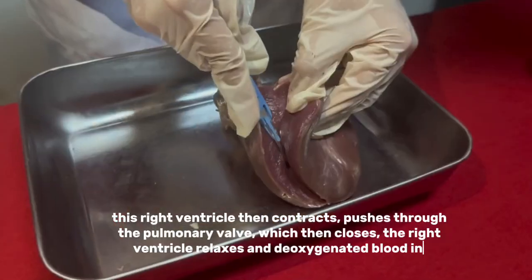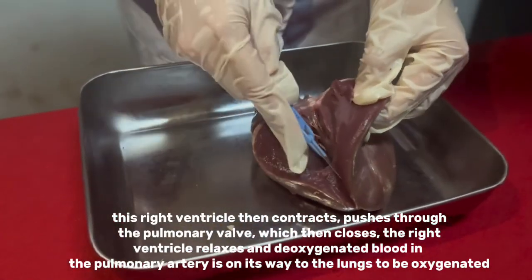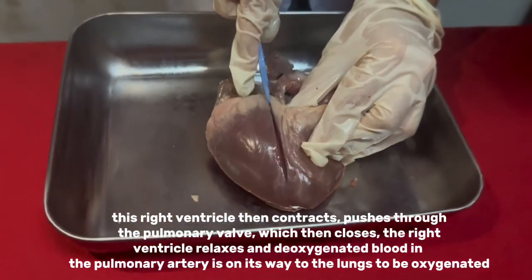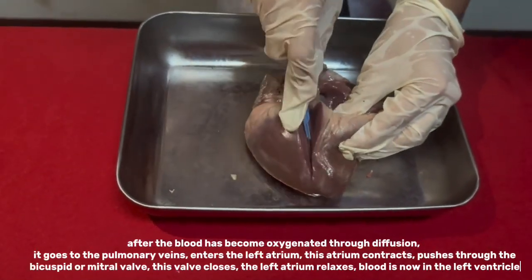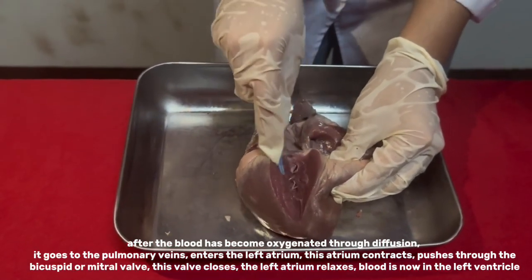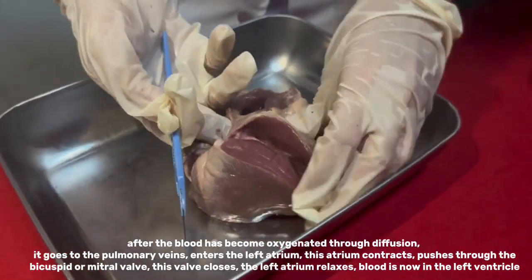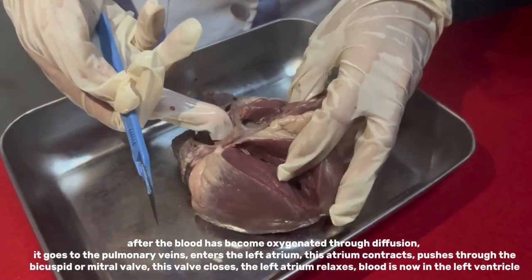This right ventricle then contracts and pushes blood through the pulmonary valve, which then closes. The right ventricle relaxes and deoxygenated blood in the pulmonary artery is on its way to the lungs to be oxygenated. After the blood has become oxygenated through diffusion, it goes to the pulmonary veins and enters the left atrium. This atrium contracts and pushes blood through the bicuspid or mitral valve. This valve closes, the left atrium relaxes, and blood is now in the left ventricle.